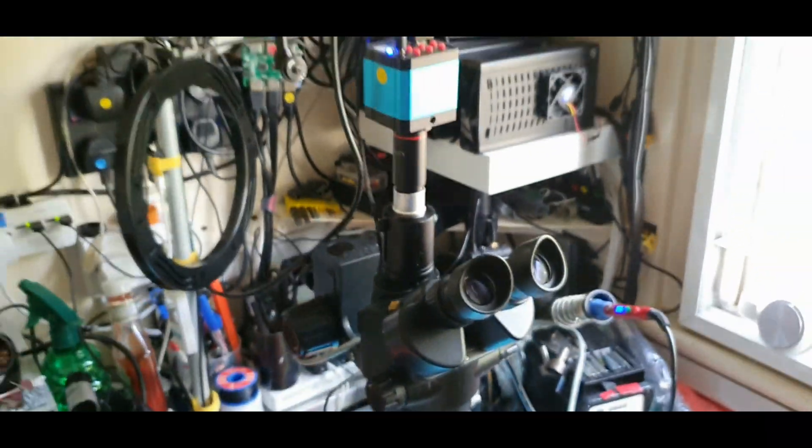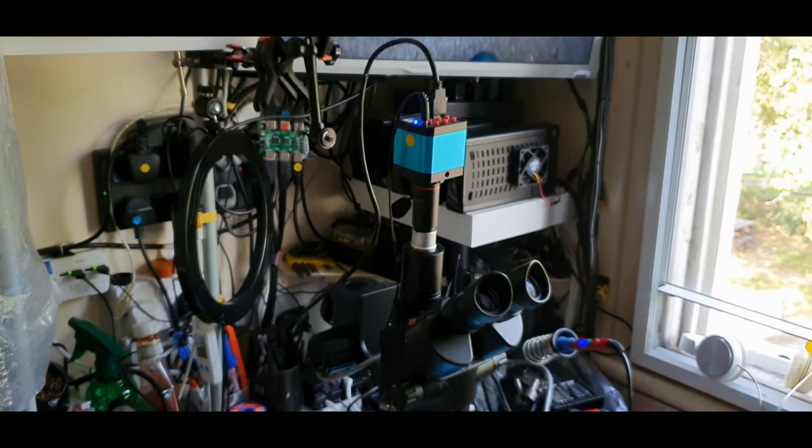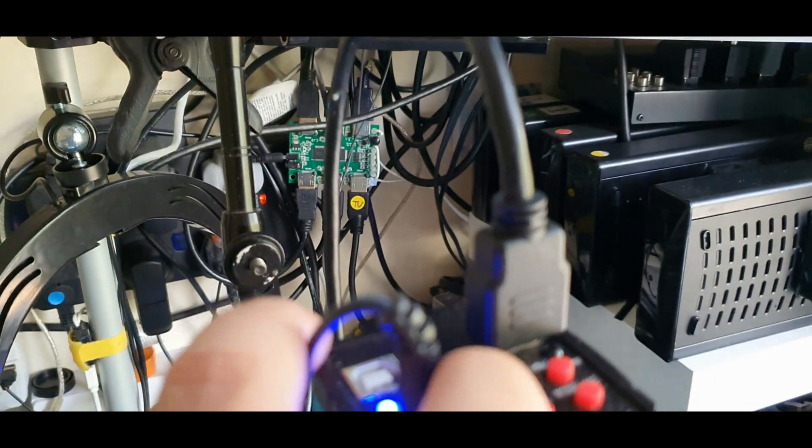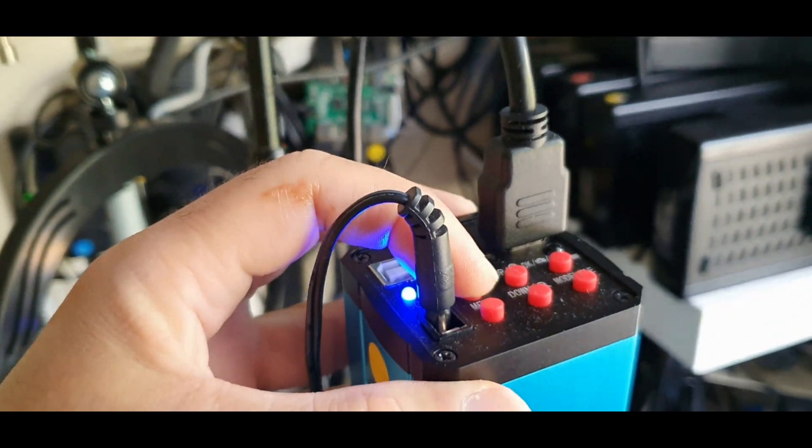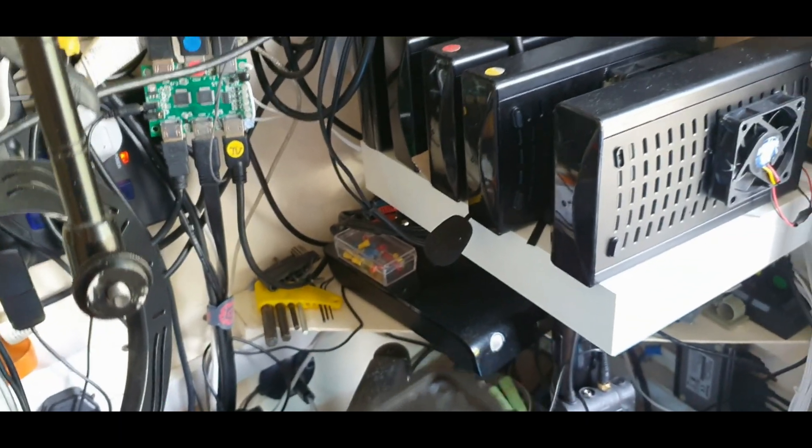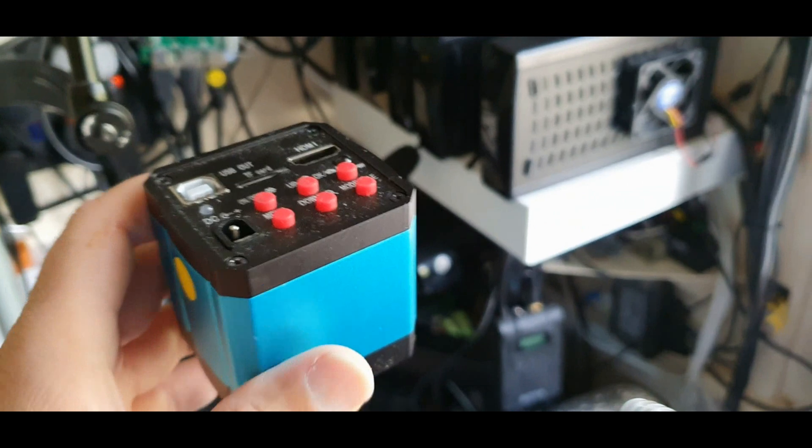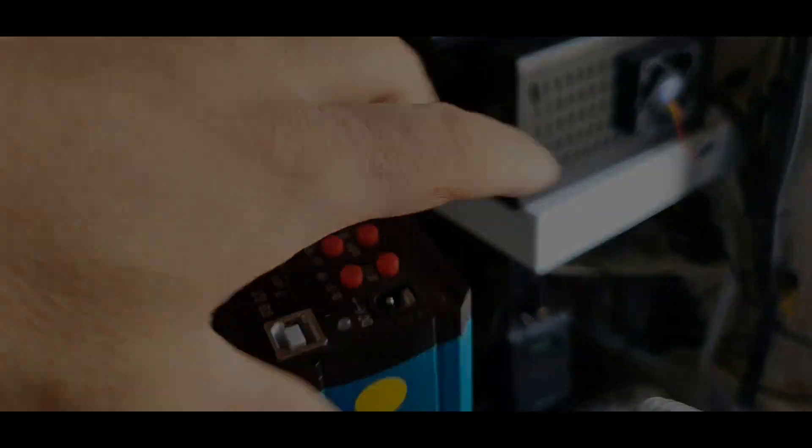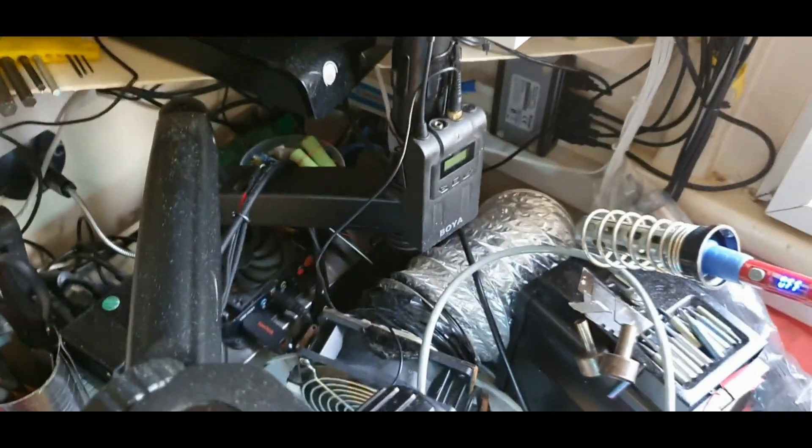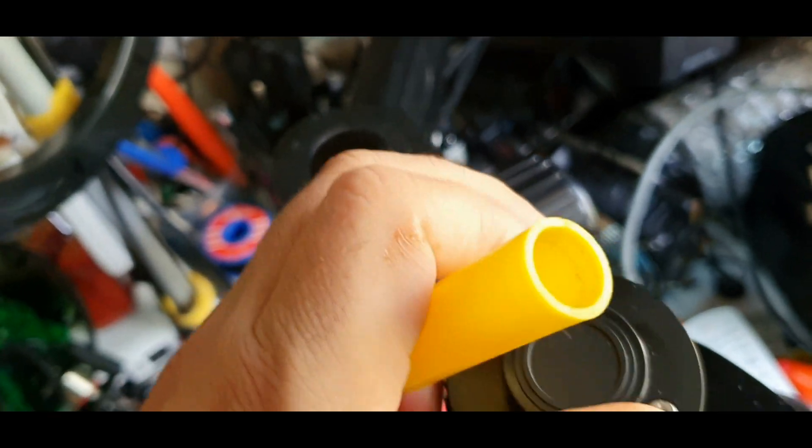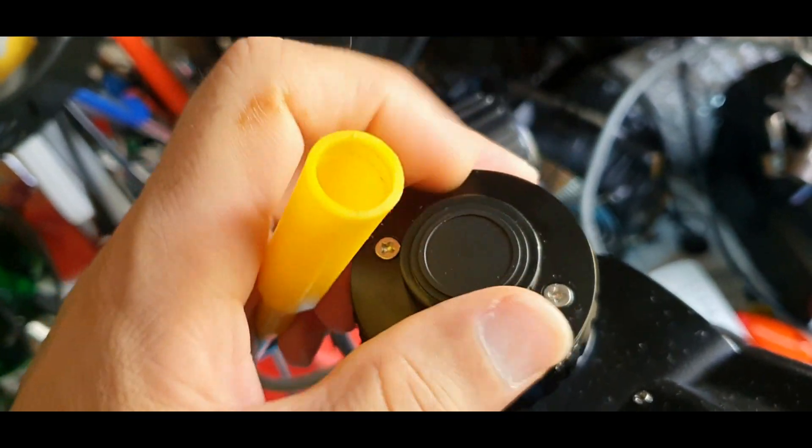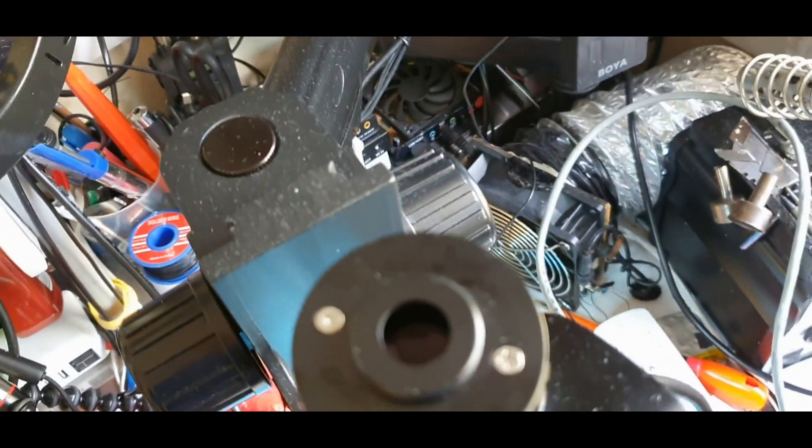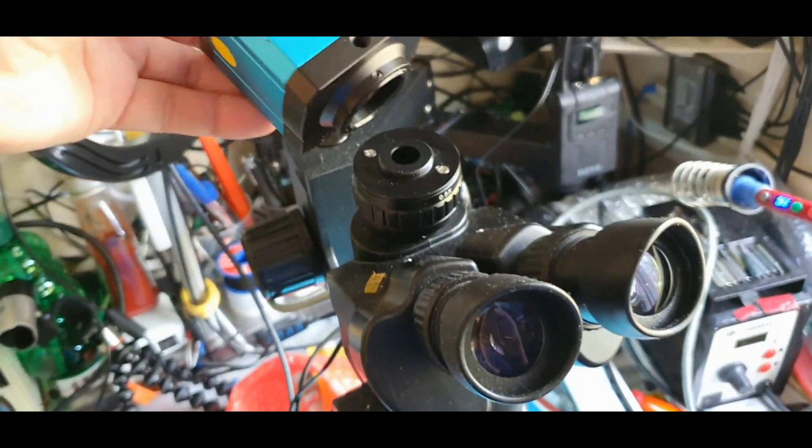Let's go look a bit so you can see. I want this off now. No, I won't go yet because I can put the camera on it. Let's get this cup off. Let's get the scope of the camera off.